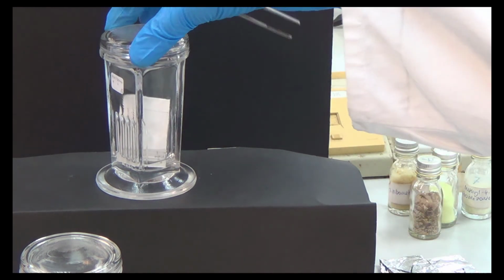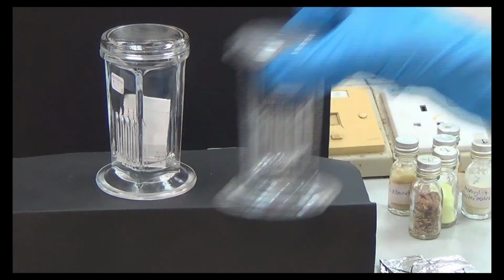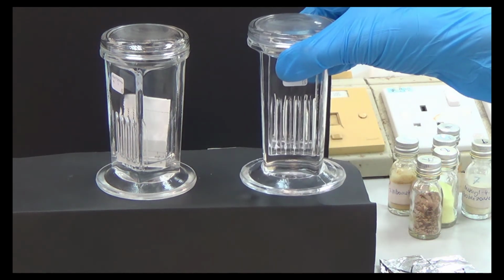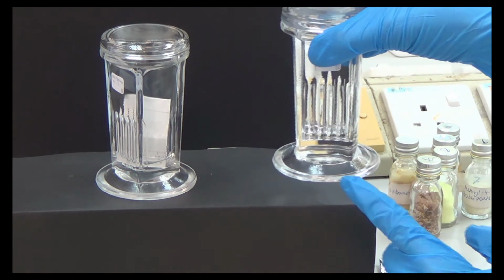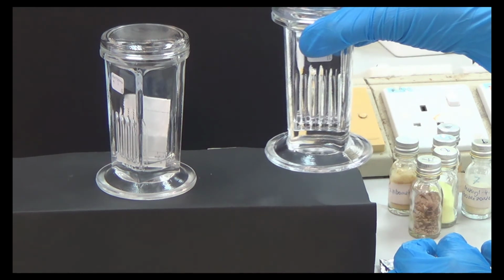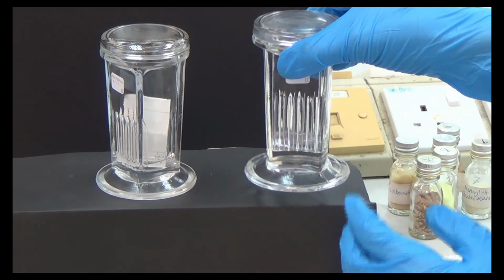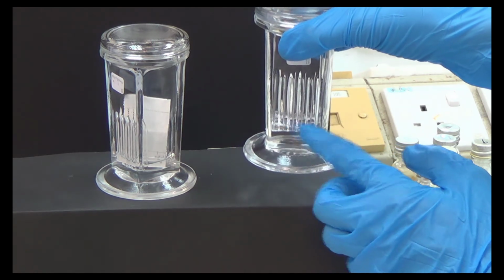Okay, the idea is that the different solvents here, this and this, have a little bit different polarity. Because of that, they behave differently when they meet the silica gel. Same as a compound: if you have a polar compound, it will stick very tightly to the silica gel. Similarly, this mobile phase is the same as a compound also.